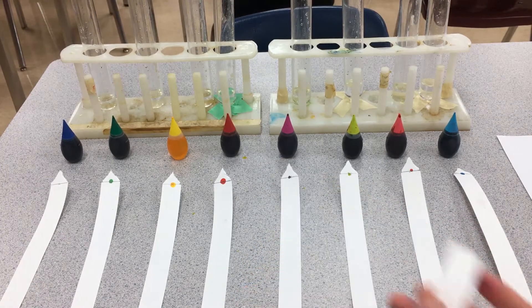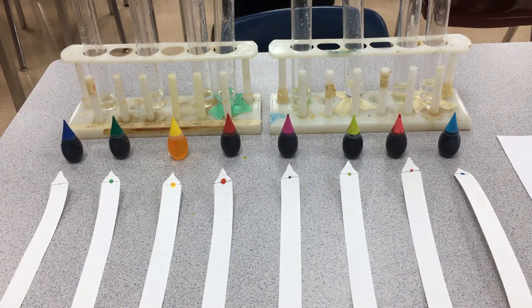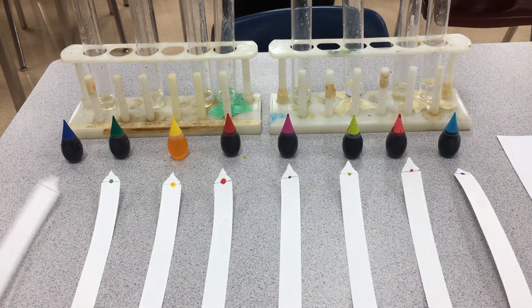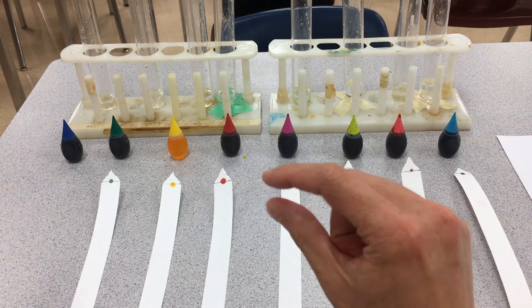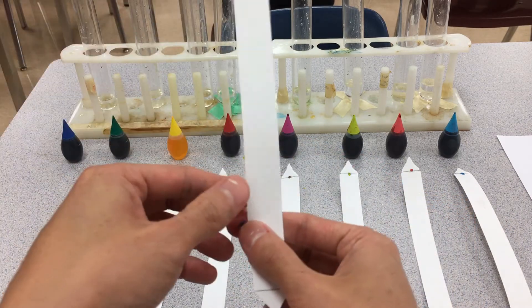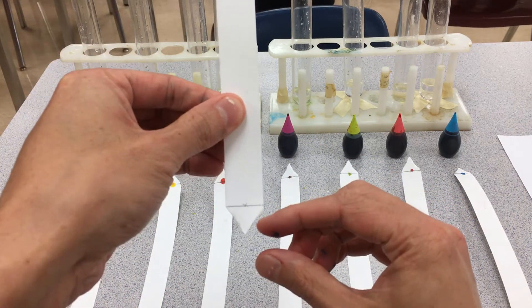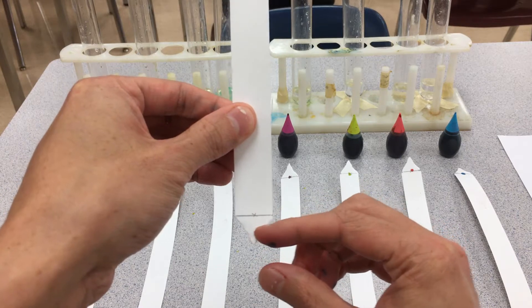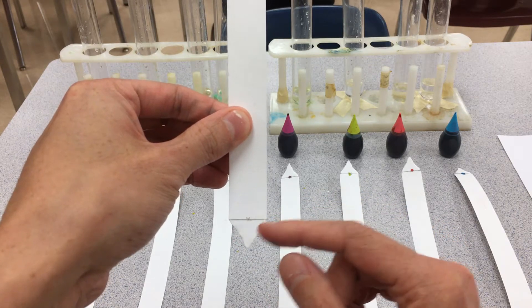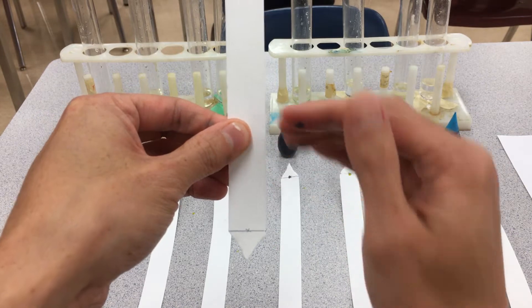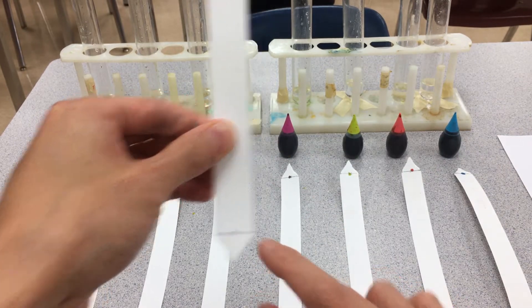The hope is that eventually when I dunk the triangle inside the test tube, each test tube in front of me has been filled with about a centimeter deep of water. I'm going to fill the water up so that the water covers the bottom half of the triangle. This shape is used to try to encourage the water to come up fairly flat.